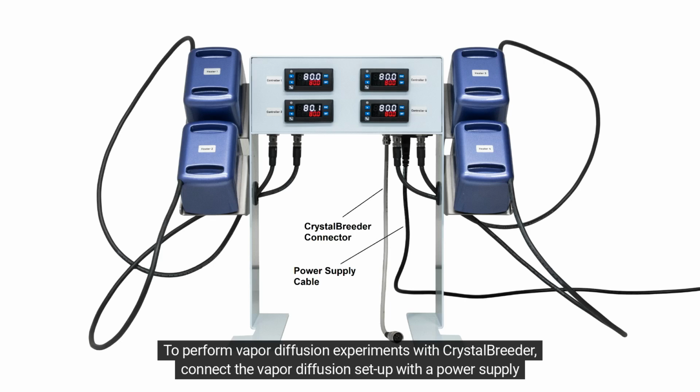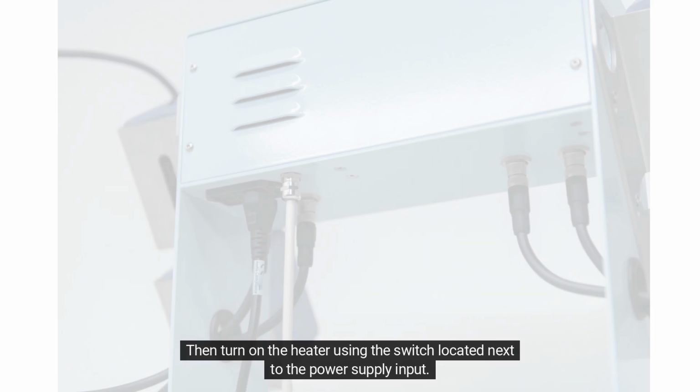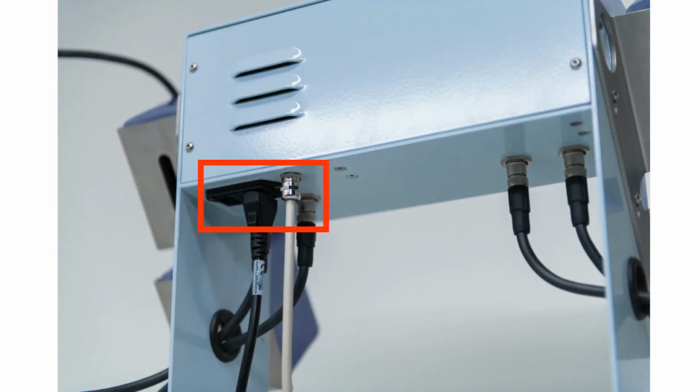To perform vapor diffusion experiments with CrystalBreeder, connect the vapor diffusion setup with a power supply cable and the CrystalBreeder connector. Then turn on the heater using the switch located next to the power supply input.